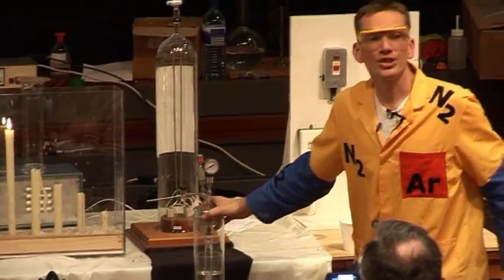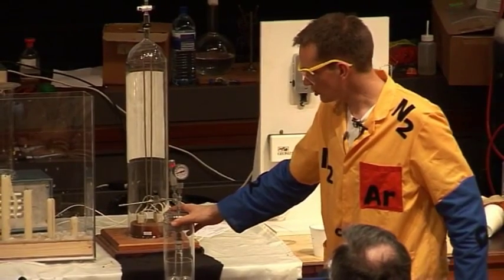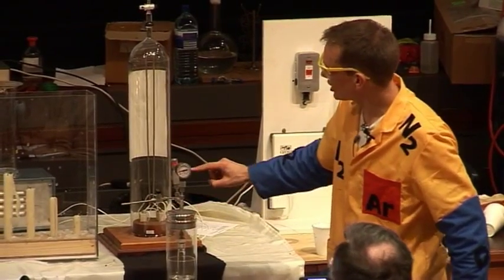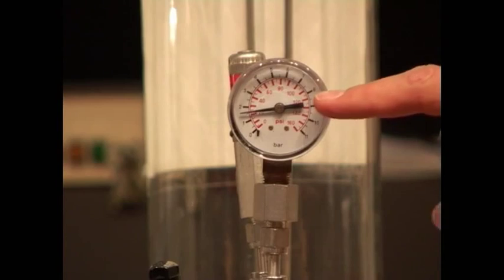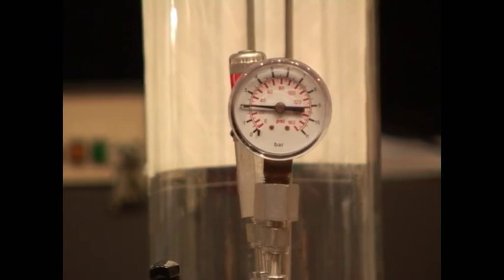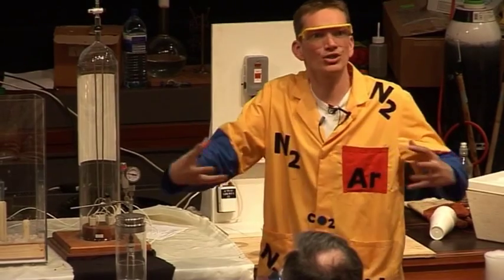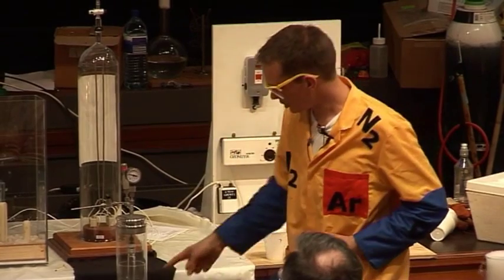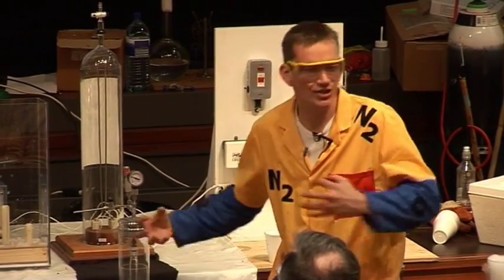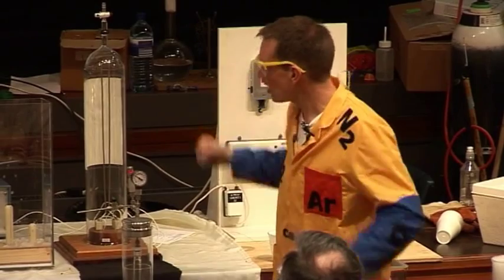Now, what's going on here? The solid carbon dioxide is turning straight into a gas, and you can actually see the pressure building up inside this test tube. There's nowhere for the gas to come out. The gas takes up much more space than the solid, and as the solid turns into the gas with nowhere to go, the pressure is building up.